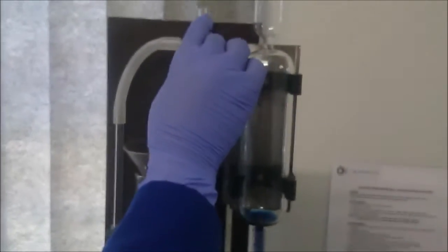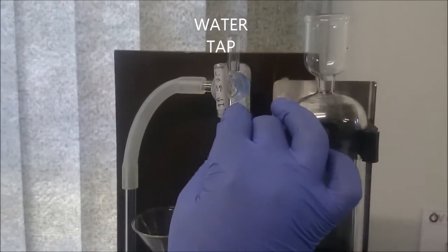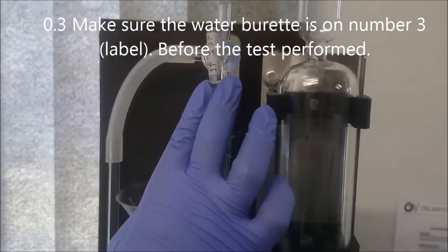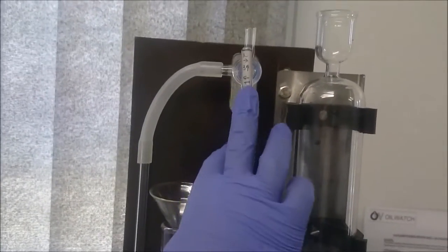And above that is the water tap. It must be on level three, and yes, it's on level three now.